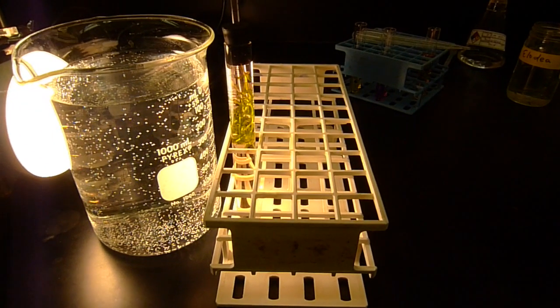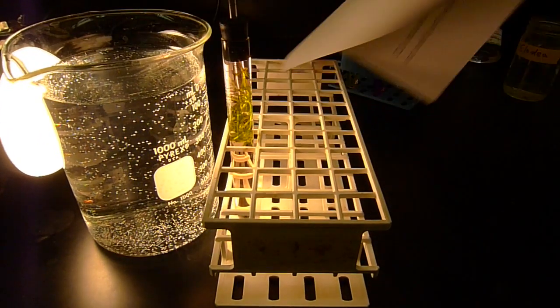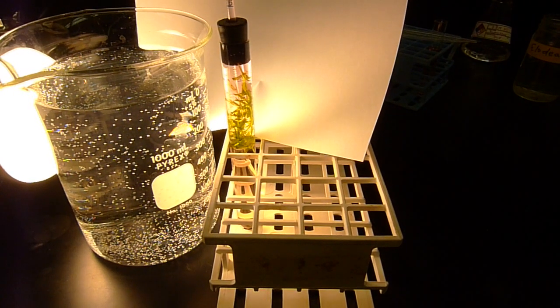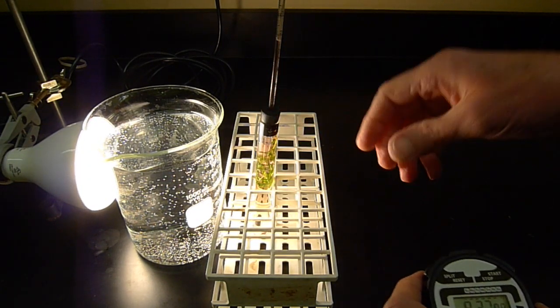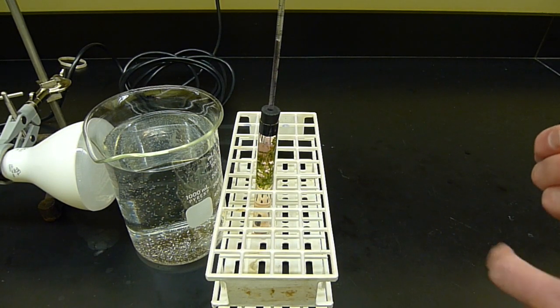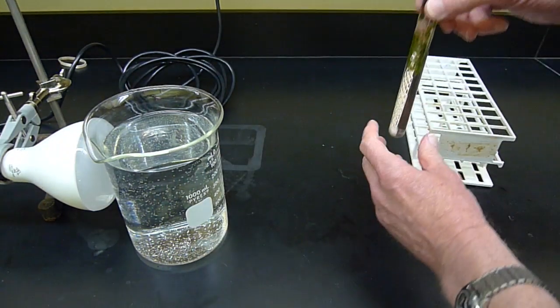So there it is at time 0, relatively yellowish. Does this work? Kind of. Well, let's see what happens with the color in a few minutes. So things have been photosynthesizing away here. It's been like 9.5 minutes. I'm going to shut the light off so you can actually see this a little bit better. Then I'm going to start the stopwatch at 9:45, almost.